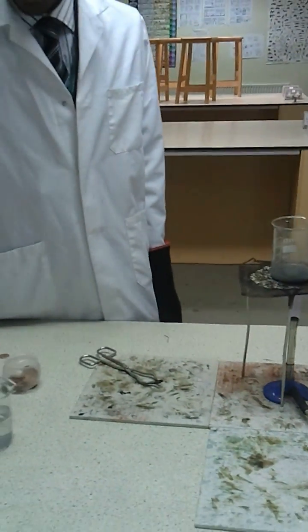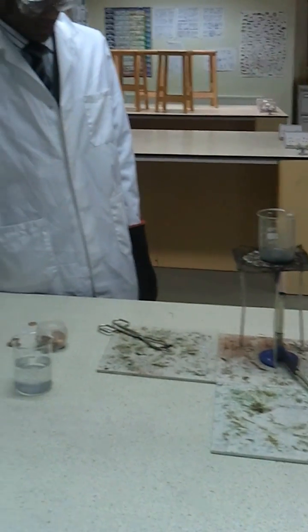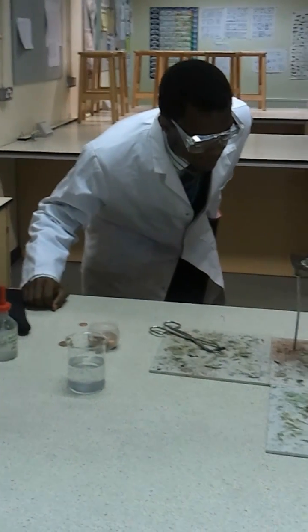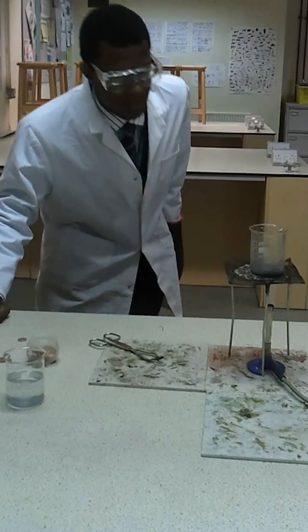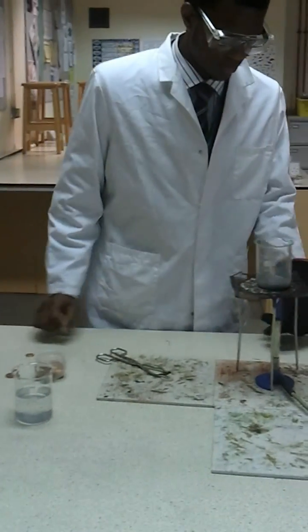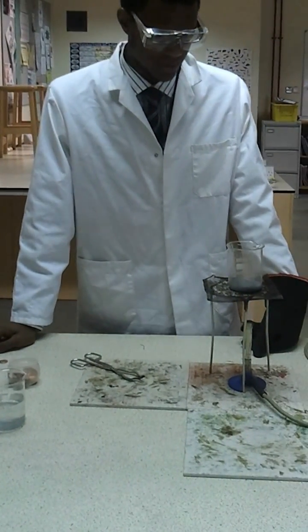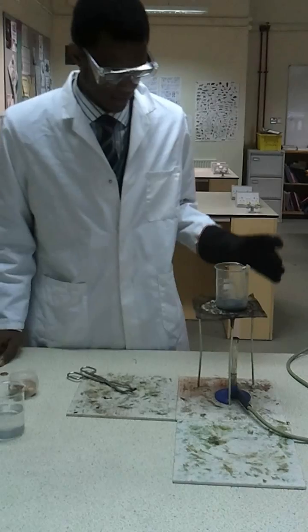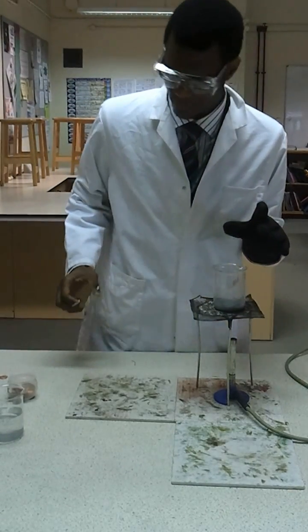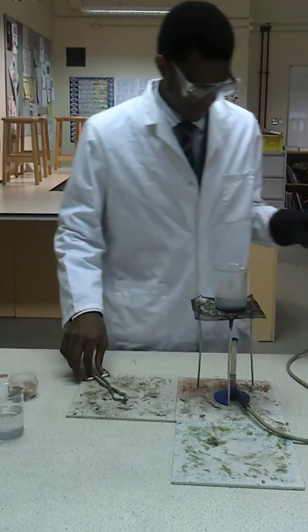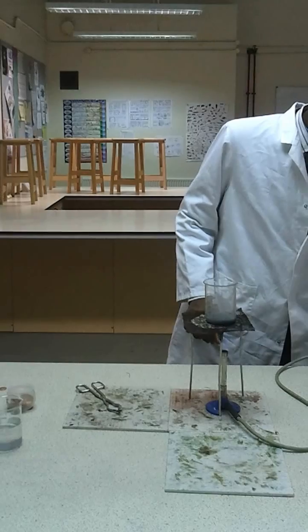So the sodium hydroxide - here I've got about 45 milliliters, just enough to cover the coin. And just add as much zinc as you need, not too much.